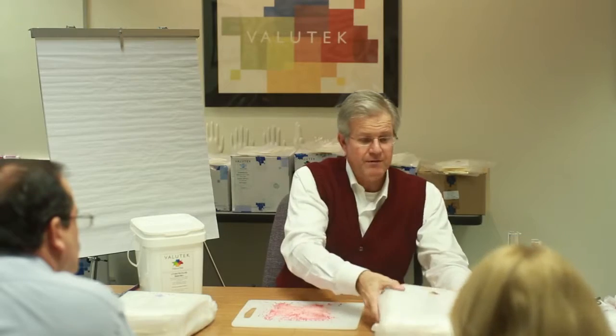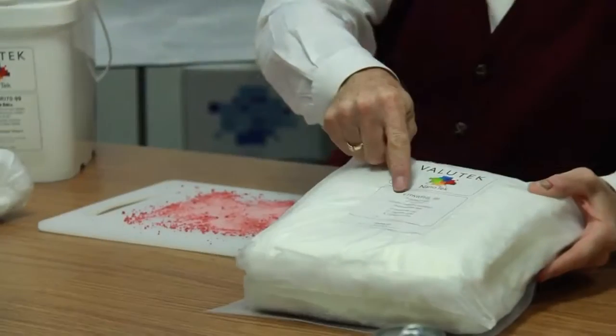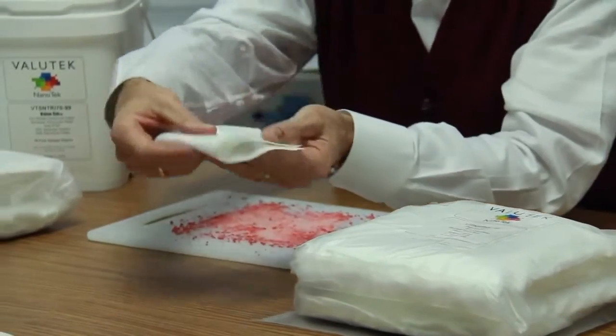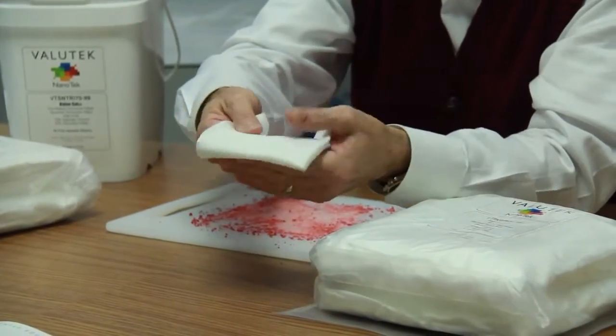So this is just an illustration using gross contamination because we can see it. If we did this test with submicron contamination, we couldn't see the particles, so we couldn't illustrate it. But large particles behave the same way that small particles do. And first what I want to do is take one of our best-selling wipers. This is our polyester, standard weight, pressure heat sealed wiper. So it's a very, very clean wiper.